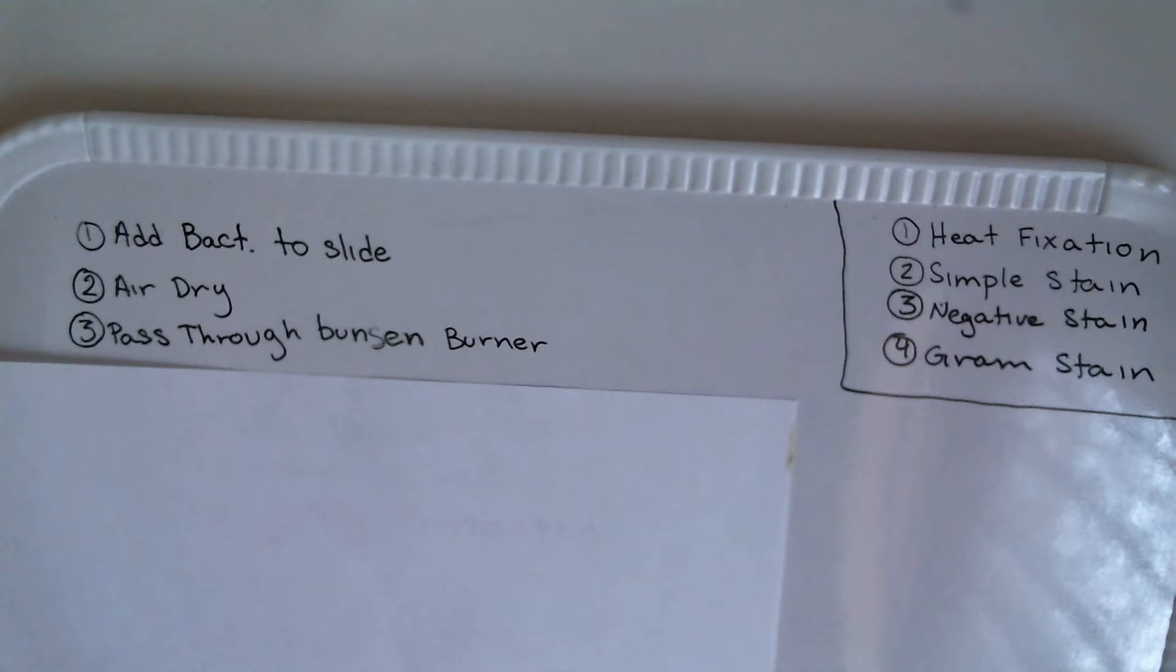Some of the pros of doing heat fixation is that it kills the bacteria for one, and another as you can see is that it's easier to see.